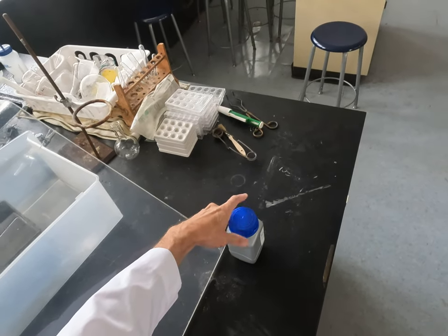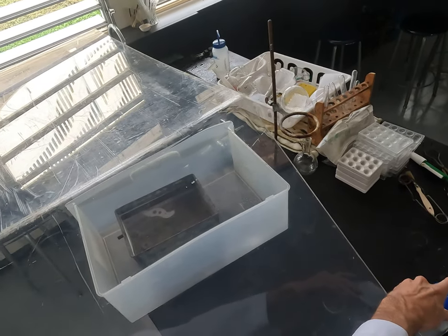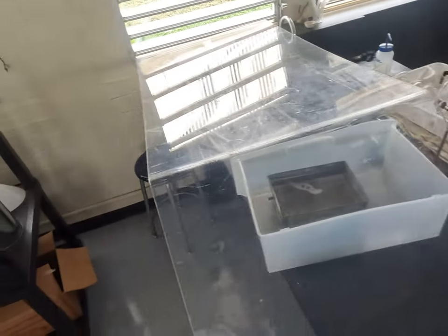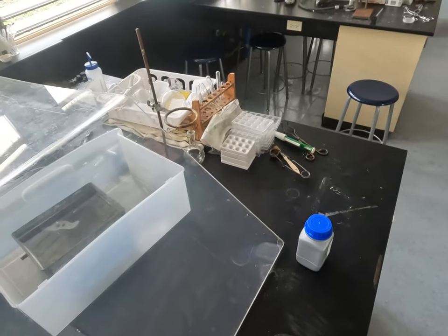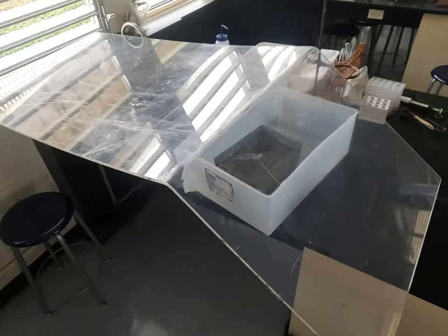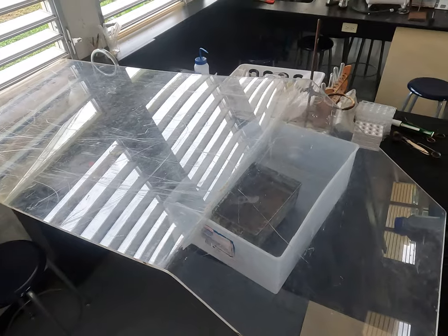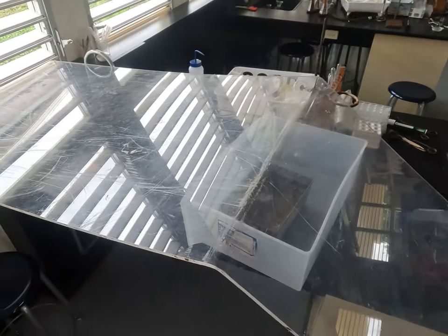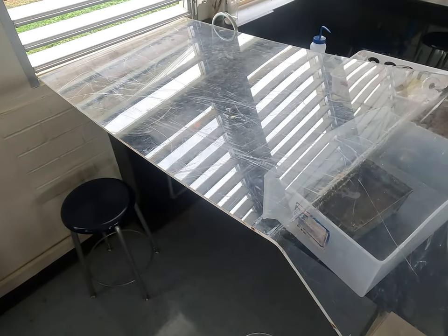We're gonna see what happens when we combine it with water. I put a little bit of this stuff called phenolphthalein in the water. Does anyone know what phenolphthalein is? We haven't really talked about it. Phenolphthalein is a pH indicator.